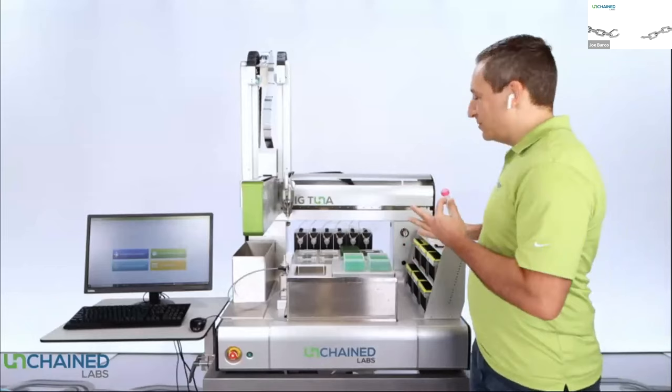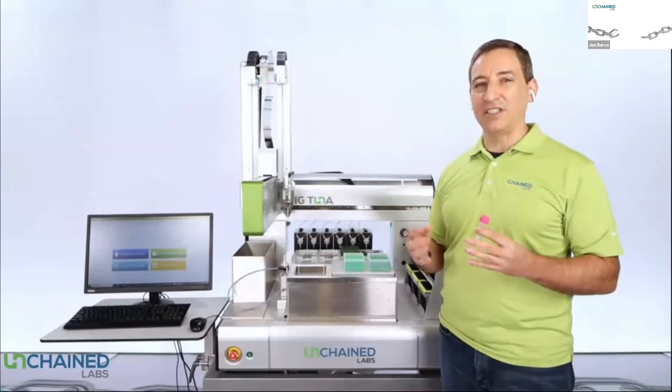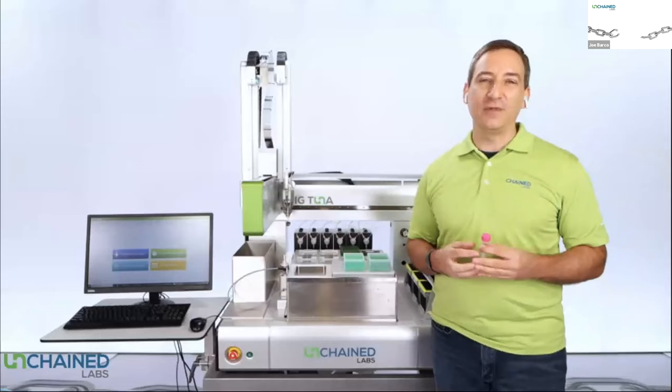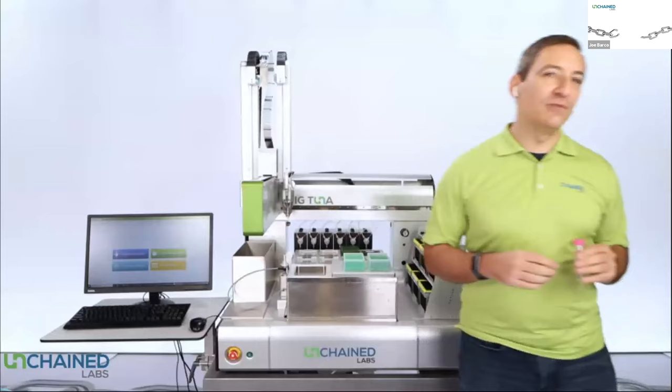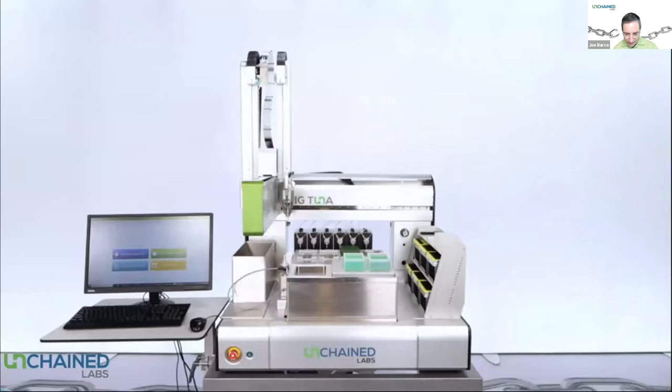So this is the instrument. It's a fully automated platform. We have designed the software to be intended for a novice user to come up and use it — someone who is more of a protein scientist than an automation engineer, although an automation engineer can still use it as well. Let's first talk about the principles and the benefits of automating it, and then we'll talk more specifically about the hardware.